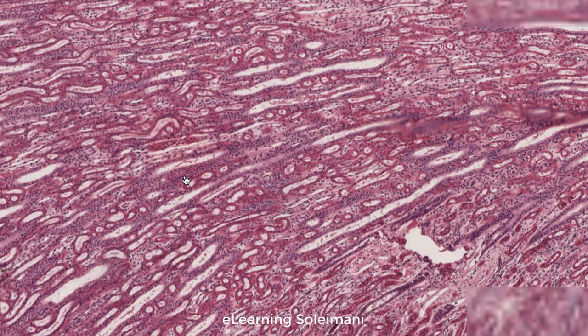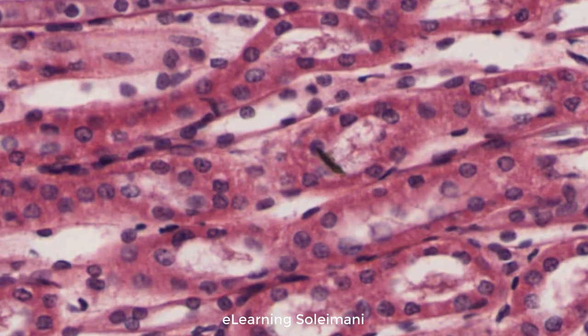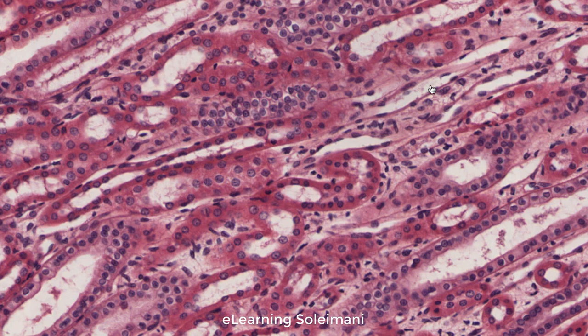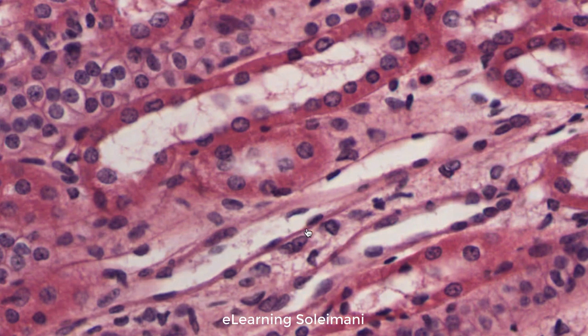In the medulla, the loop of Henle is composed of a thick portion that continues to the straight proximal tubule, converting to a thin descending portion that turns back toward the cortex as a thin ascending portion that converts to a straight portion of distal tubule. The thick portions have a morphology of either proximal or distal tubule.